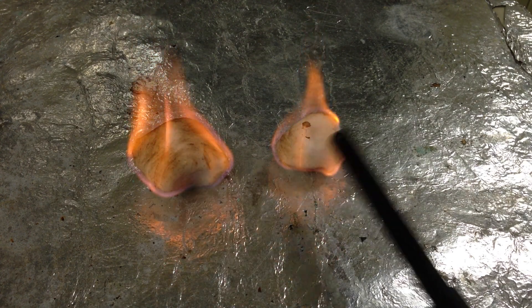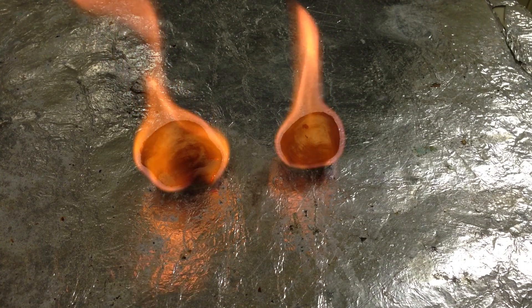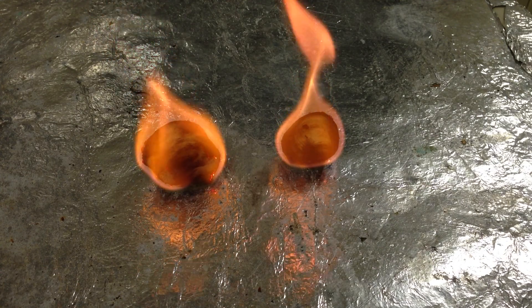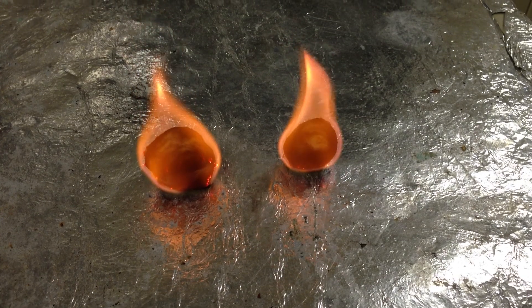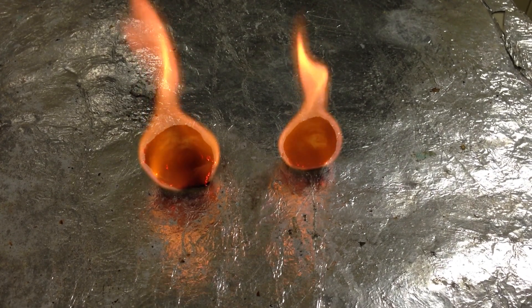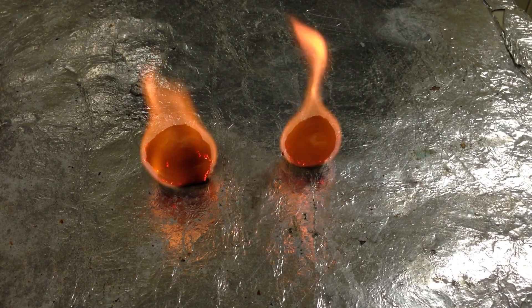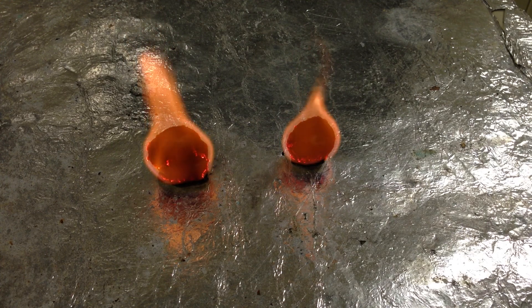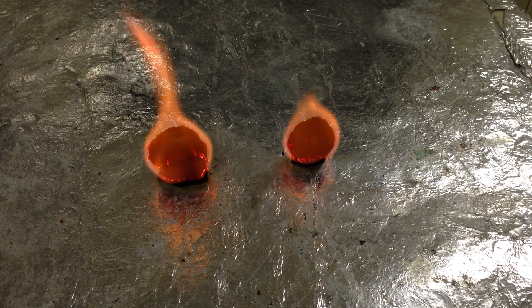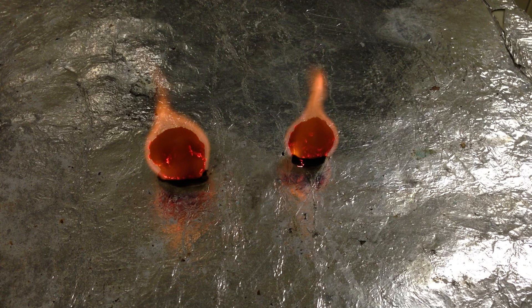So here's our classic combustion, and there we have our fiery inferno of cotton balls — or I should say cotton spheres. What you're seeing is the exothermic reaction between the oxygen and the carbon.